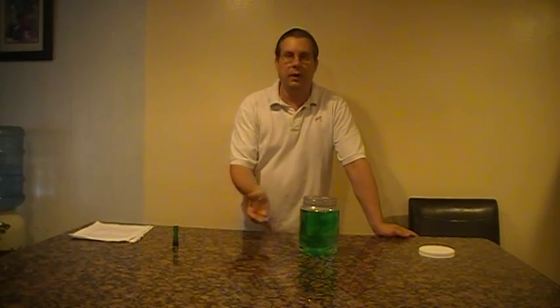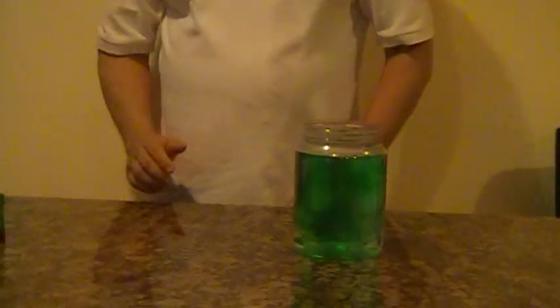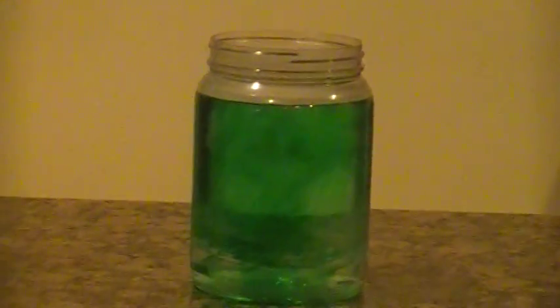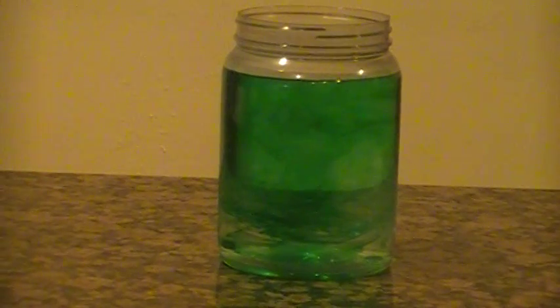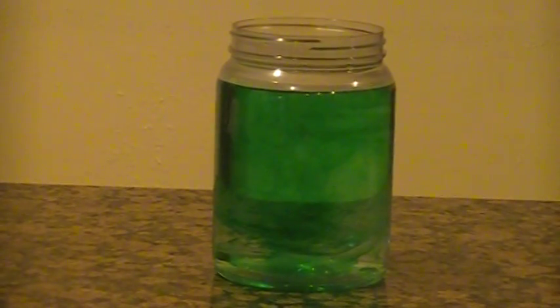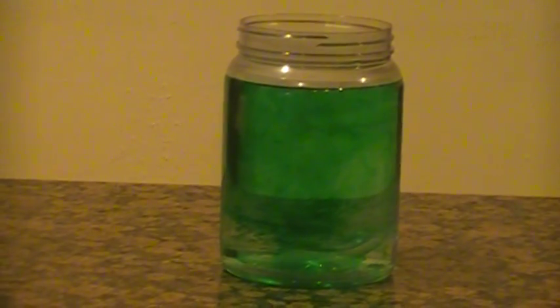Okay, for the next 30 seconds or so, please enjoy as you watch the dye completely become diffused with the water. Let's start. Thank you.